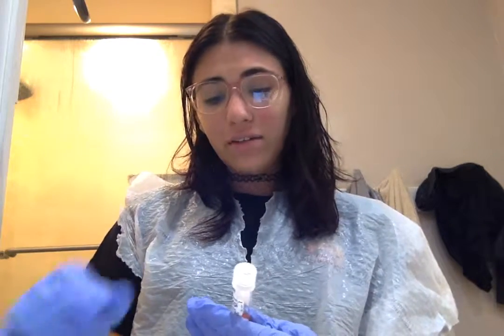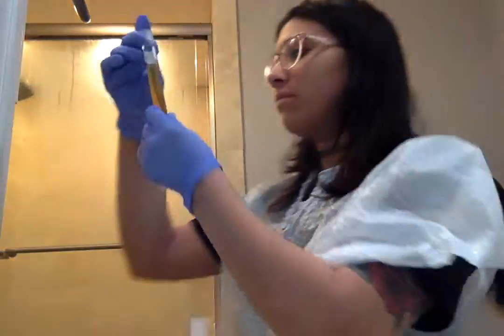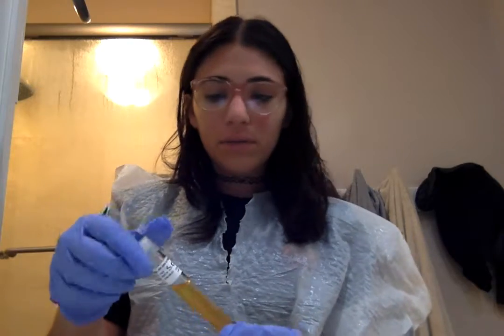So they incubated for a total of 20 hours. I didn't stop to check on them at the 12 mark because I misread and I thought it was just 20. But that's interesting. So I'm just going to be recording my results.